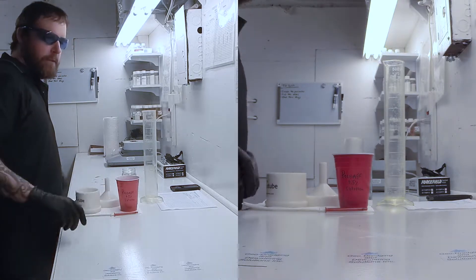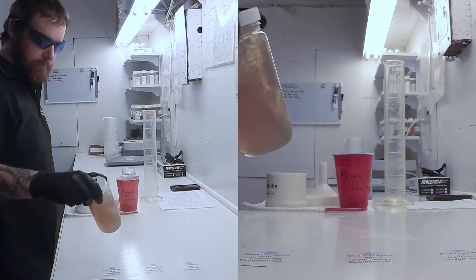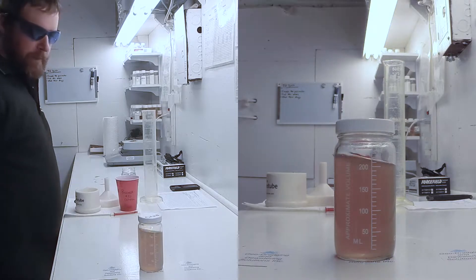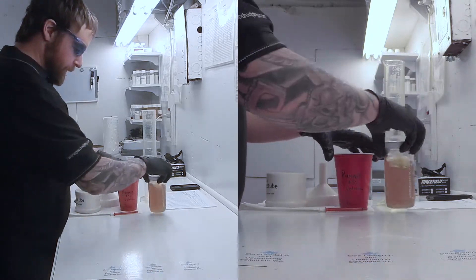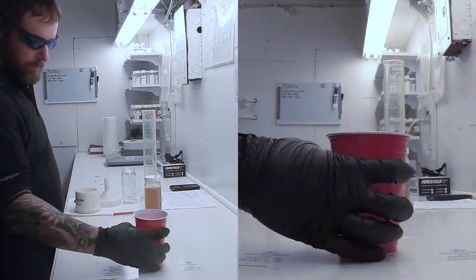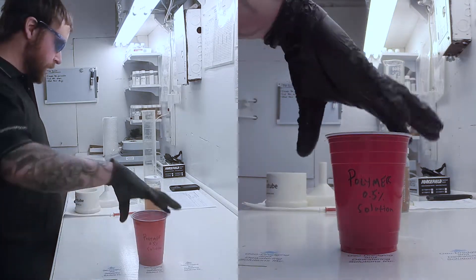Next, you'll need some raw material. That's what we'll be using today. And finally, you'll need some made down polymer to a 0.5 solution.